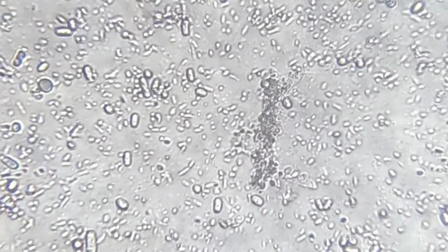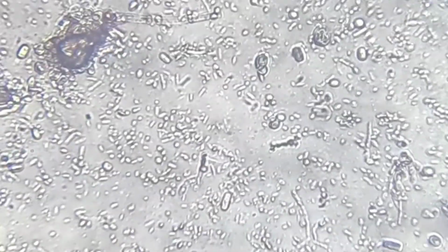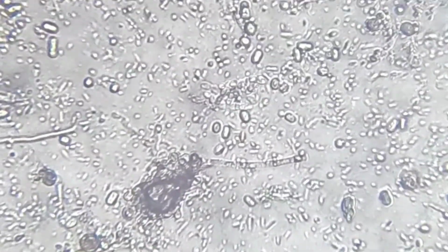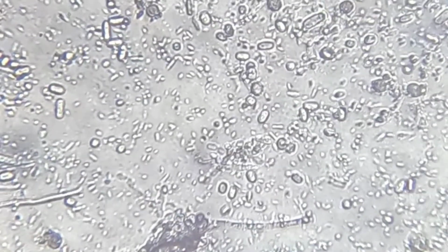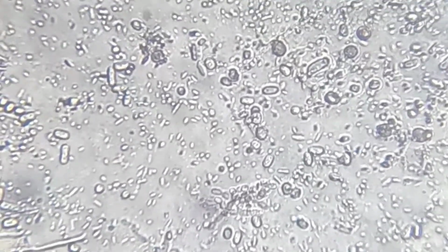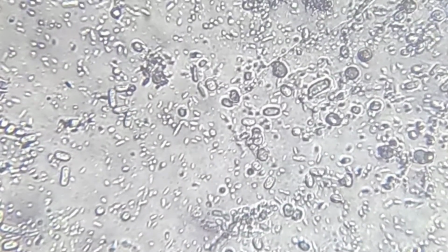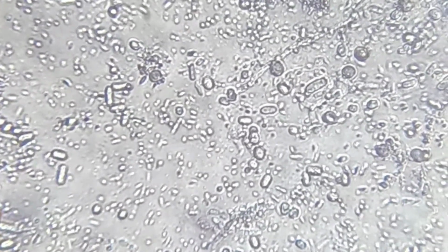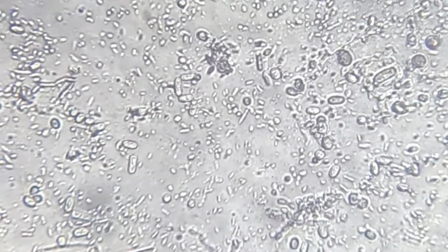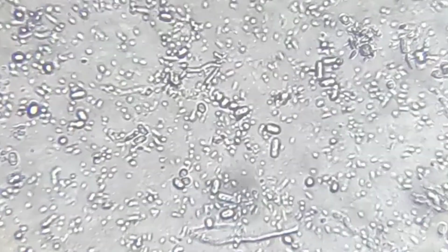If I look carefully, I can also see very tiny oval-shaped microorganisms. They are smaller than yeast but slightly bigger than the tiny round dots. These are often called coccobacilli, a shape that is between round and rod-like bacteria. They are common in spoiled fruit and actively feed on the broken down tissues of the grapes.